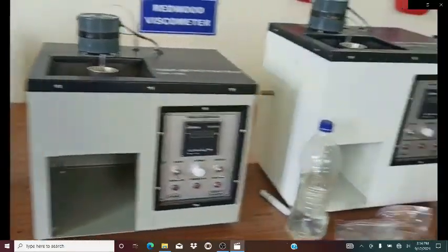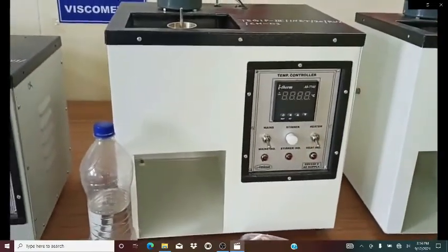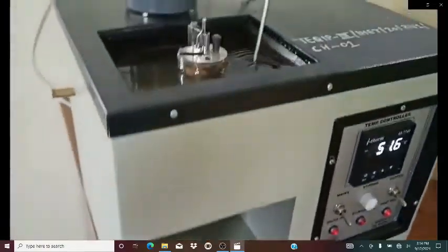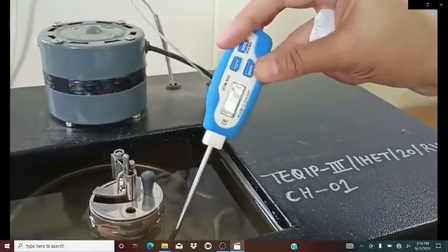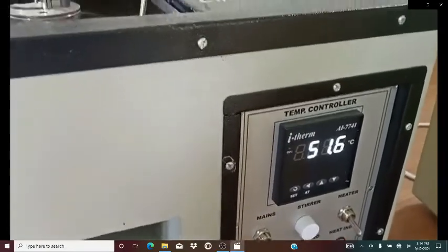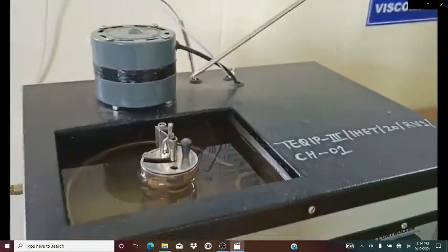Now I will show you the other instrument on which we are performing the experiment. These two are Redwood Viscometer Number One and these two are Number Two, and the same difference is visible at the bottom of the vessel. This instrument is already heating up to 51.6 degrees — you can see the temperature on that thermometer. The temperature you set in the regulator is the temperature of your water, which is used to heat up the lubricating oil, so uniform heating is required.